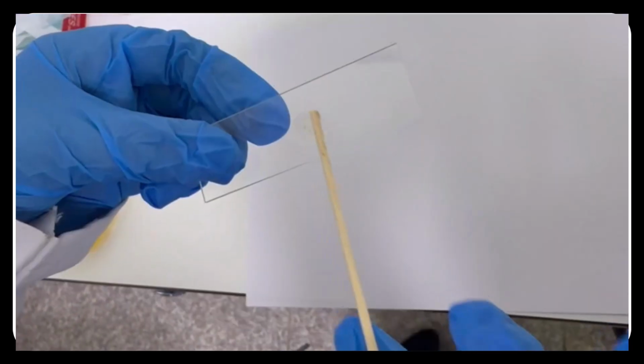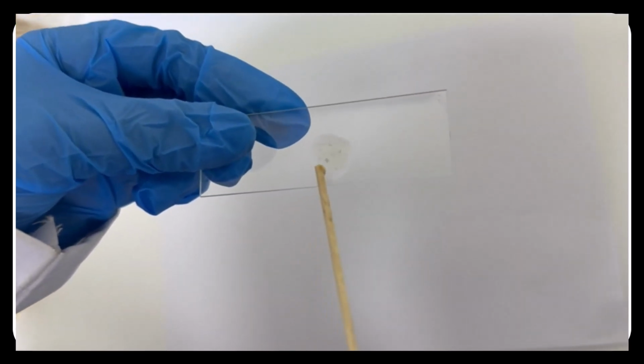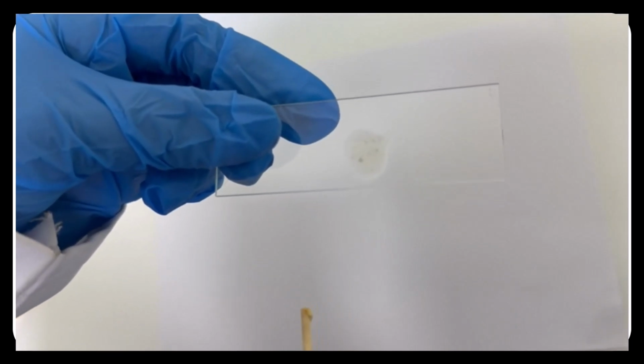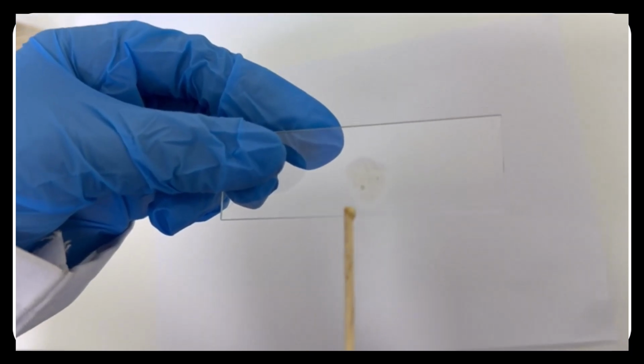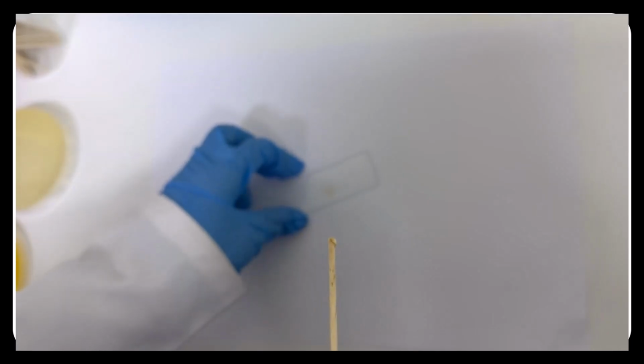If there is no clump formation, it indicates the negative result. And you can see here the clump will be formed in just a few minutes, which is indicated by the white grains on a clean slide, which indicates the positive result, as Staph aureus produces the coagulase that converts the fibrinogen into the fibrin.